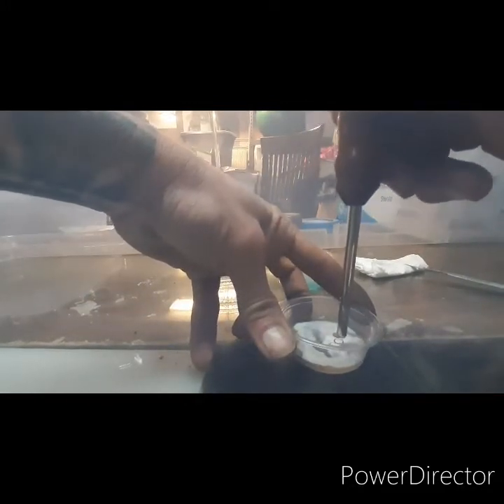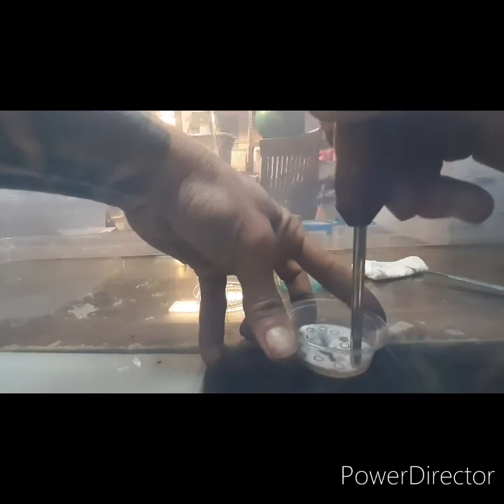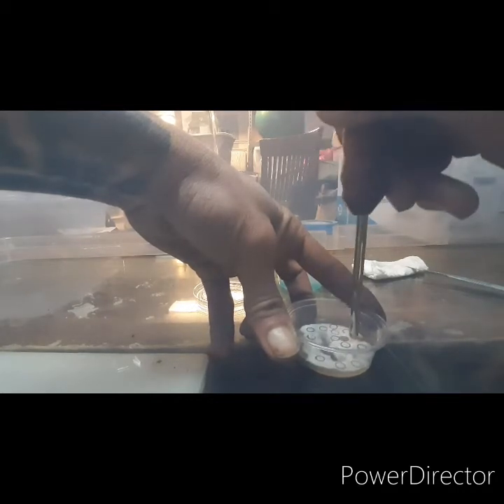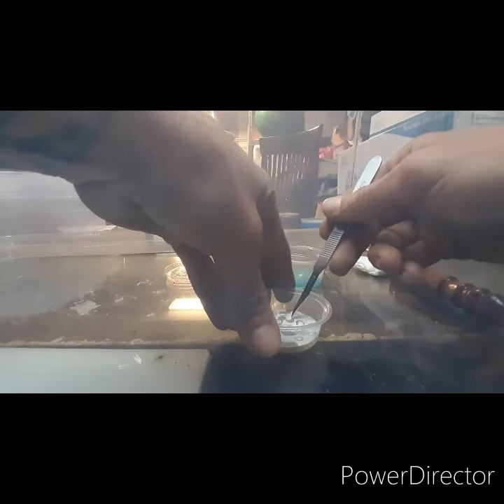To continue on to what we're doing here, just go through and pop, pop, pop, pop, pop — just as many as you want to pop. And you have all your new clean plates all stacked out.